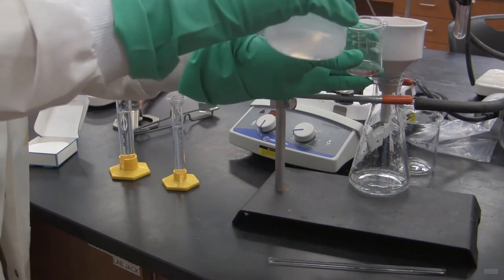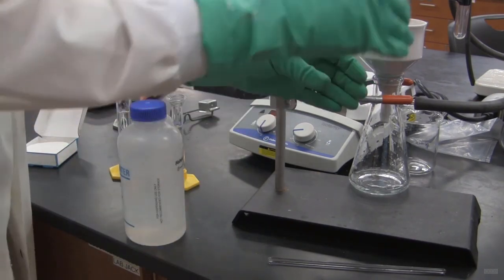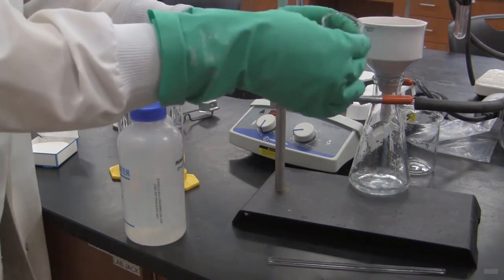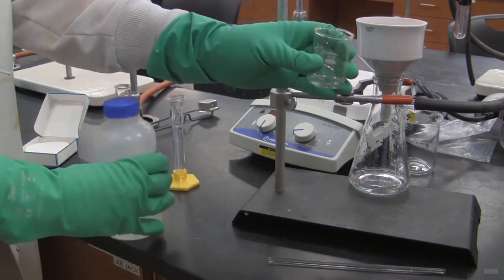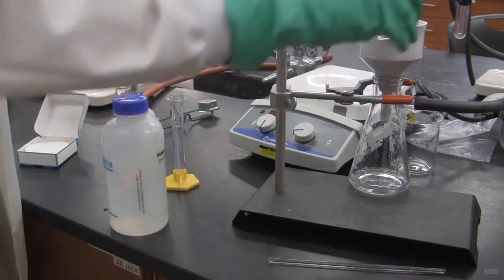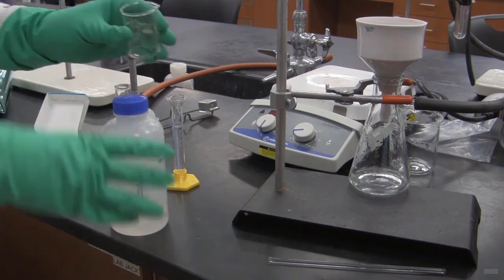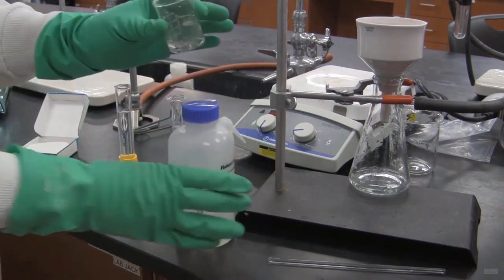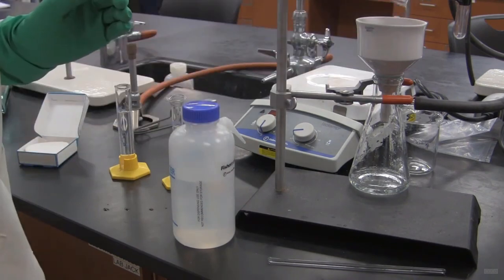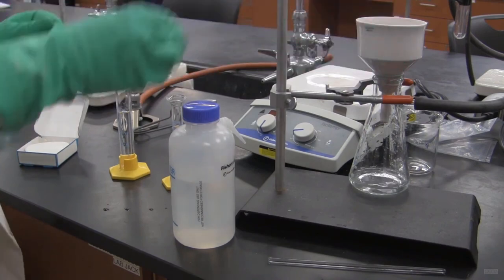So there's still a little bit left in the beaker here. So I'm going to add a bit of distilled water like this, DI water. Give it a bit more of a swirl and dump it in. A little bit more. It really doesn't matter exactly how much you use. Just as long as you get all the copper out of the beaker. Looks like I've done that.